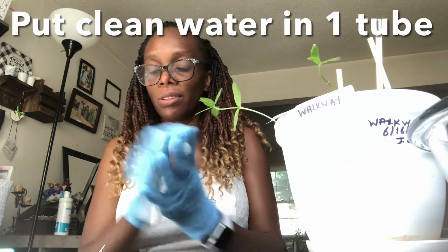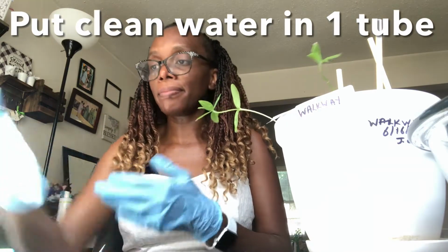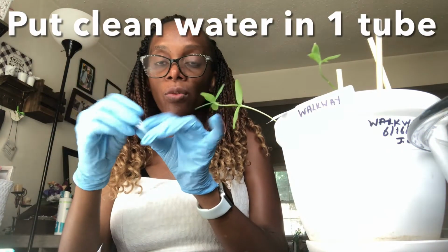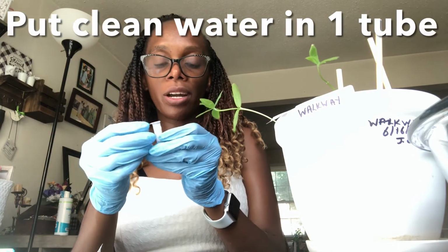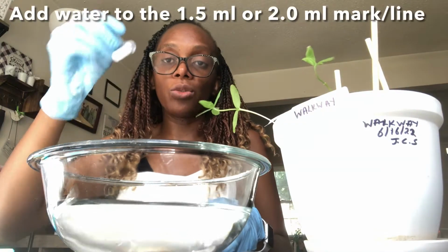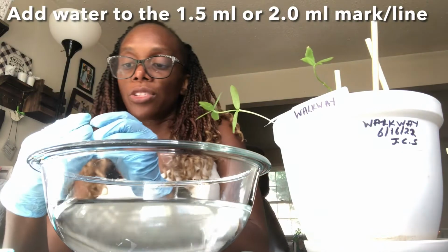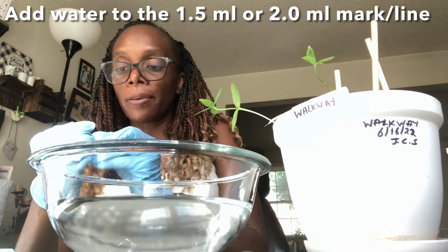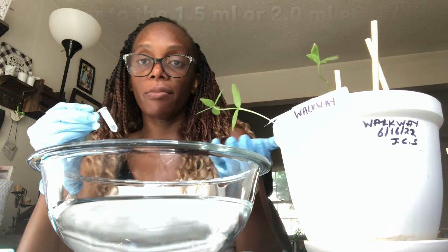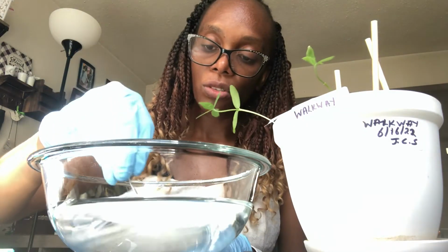So I'm just going to sterilize my hands again. Okay, so one is for clean water. So I'm just going to get some water from my tap, scoop it out, and try and get water up to the 2.0 mark or 1.5 mark. So any of those will be fine.